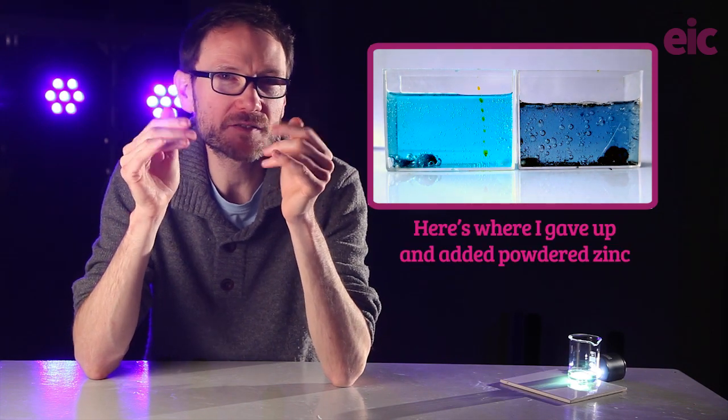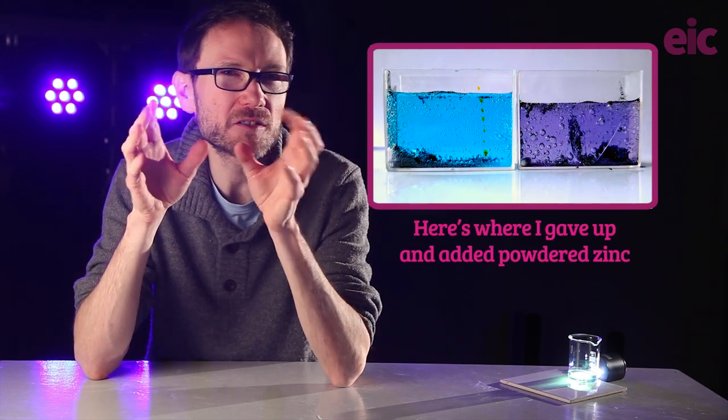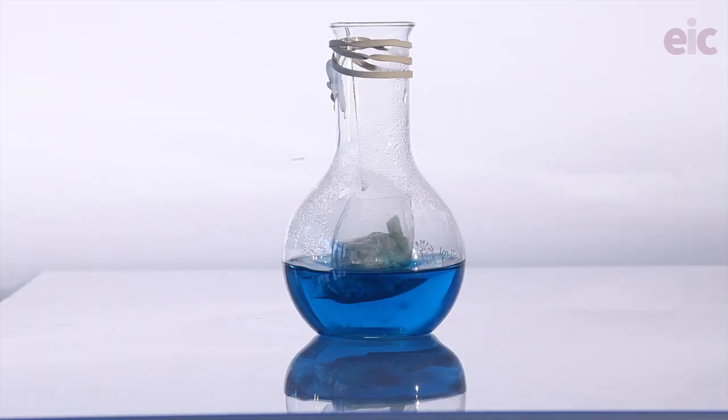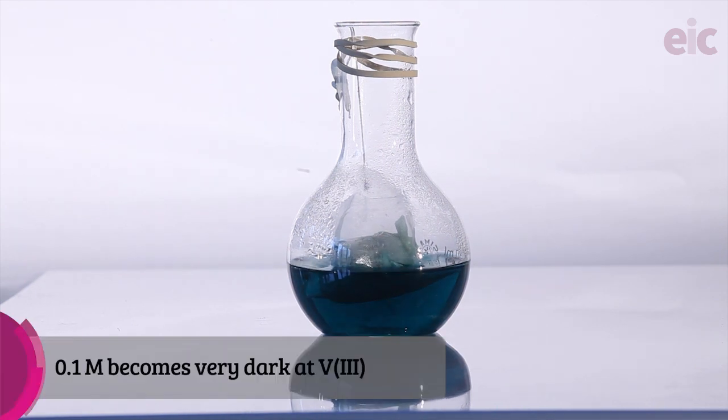I'd also realized for demo purposes you may not need solutions quite as concentrated as 0.1 molar. The vanadium 3 is actually quite dark in color, and for a slightly larger scale reaction in front of a class, you might find more dilute solutions give you better colors. Either way, with this setup, you're still going to be looking at a minimum of 50 minutes to get your reaction close to vanadium 2.